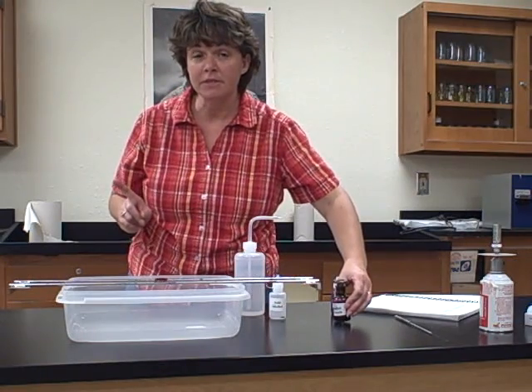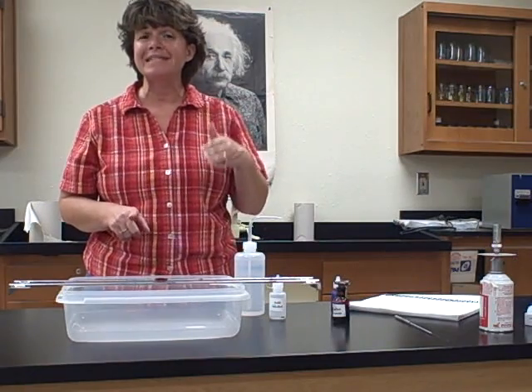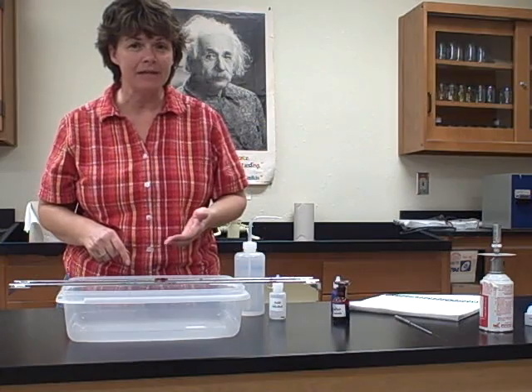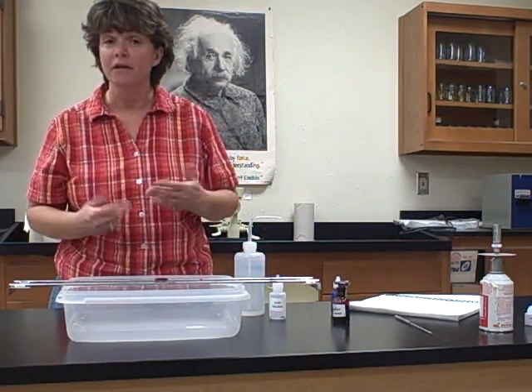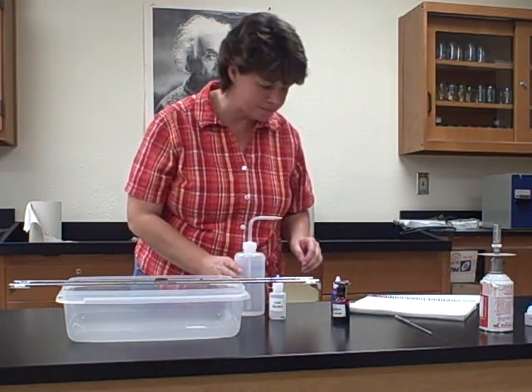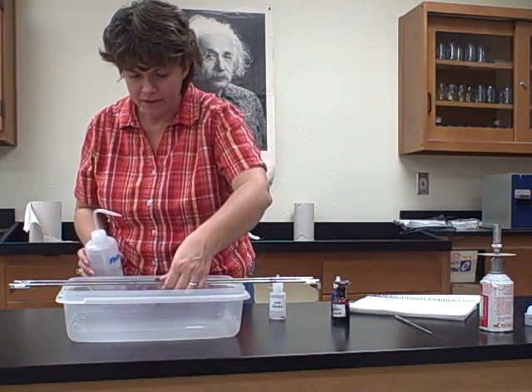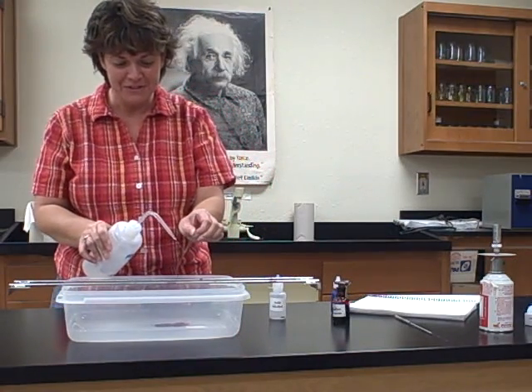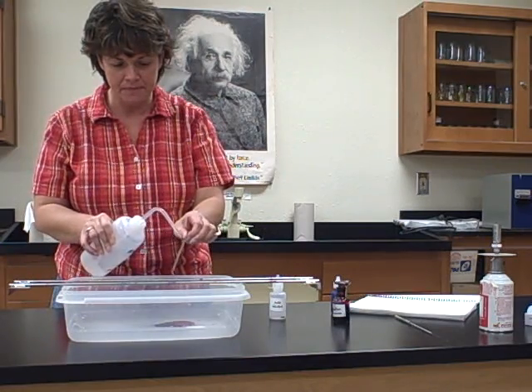Okay? Now let me take you back. I said that the acid-fast cells have a wall that is impermeable to most stains. So instead of putting it on for 30 seconds, we're actually going to let it sit for 5 minutes. Now, of course, in the video, I'm not going to wait 5 minutes. So we're going to pretend that we've waited the 5 minutes, and now we're going to wash the slide. Now, do you guys see what I don't have on is gloves? I decided not to waste them. So I'm washing it off. Okay, I'm rinsing.